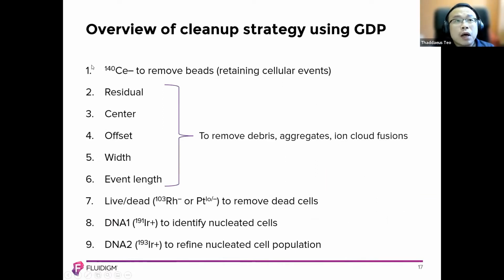Now we will start. The procedure is straightforward. We'll go from 1 to 9, step by step, as you can see. The main aim of steps 2 to 6 is to remove debris, aggregates, and ion cloud fusions. Then we will look at the removal of dead cells, to identify the live cells, using DNA 1 and DNA 2.